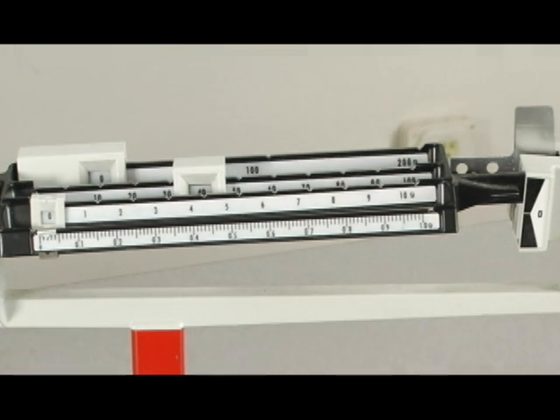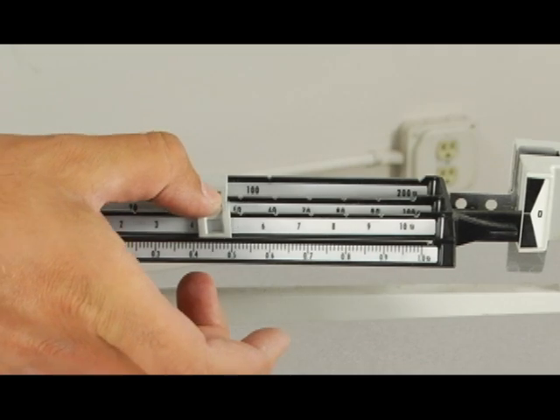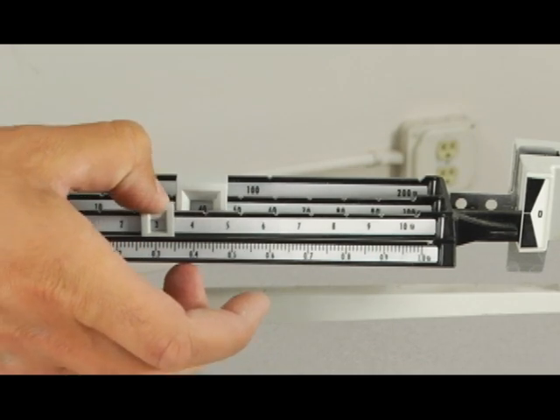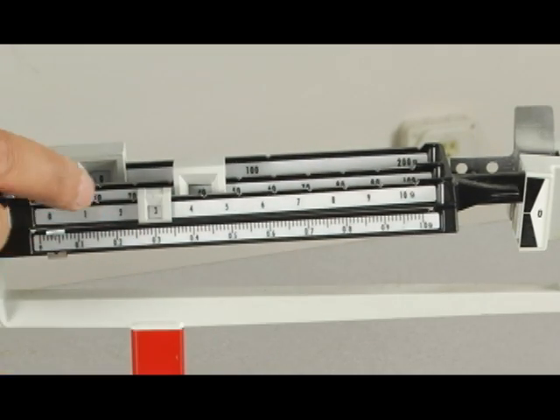We'll take it back to 40 grams and we'll adjust the single gram unit until the same thing happens and the balance slips over. We haven't added enough weight yet.